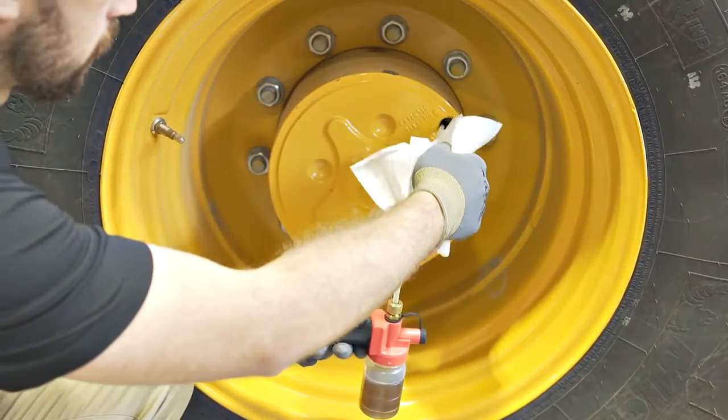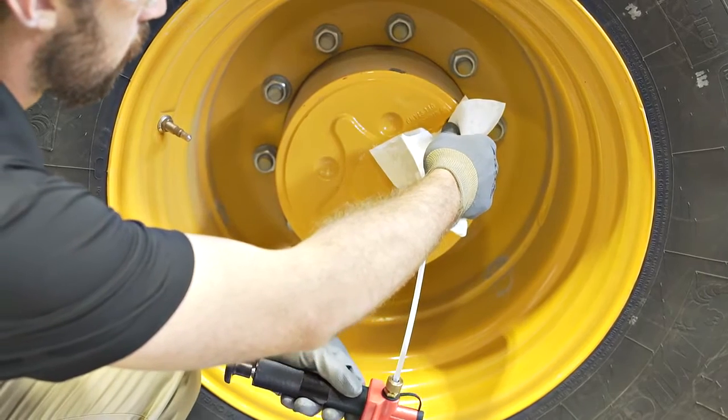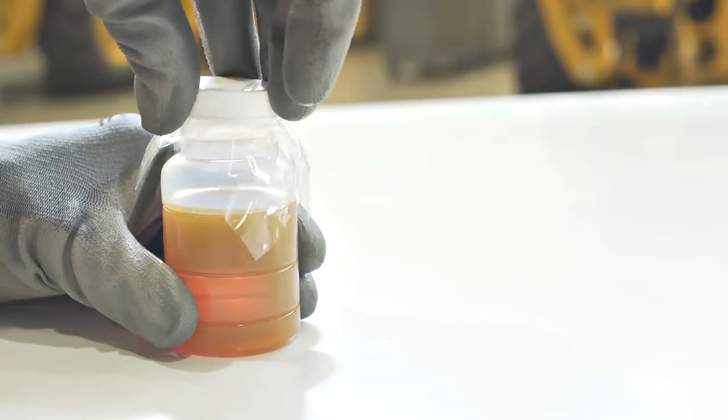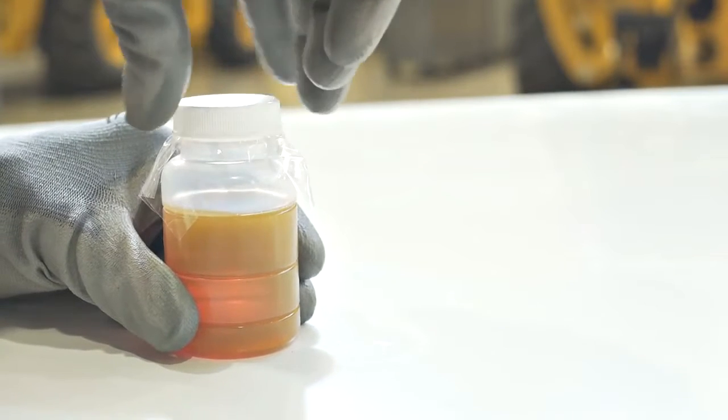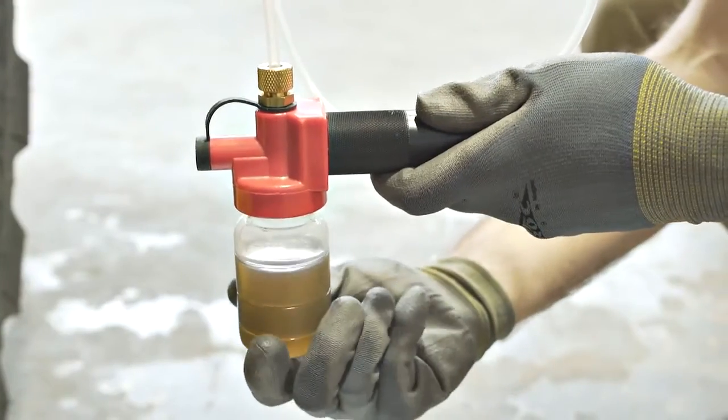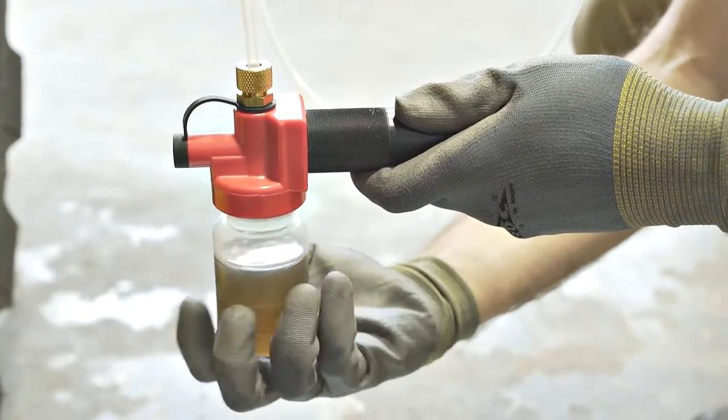Do not take samples right after a filter change, on the outlet side of a filter, or after makeup oil has been added. Freshly filtered oil removes valuable information. Adding new oil dilutes the levels of contaminants and wear metals found, which may result in conditions appearing better than they actually are.